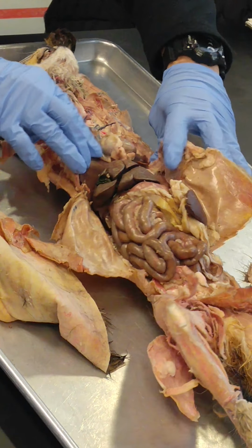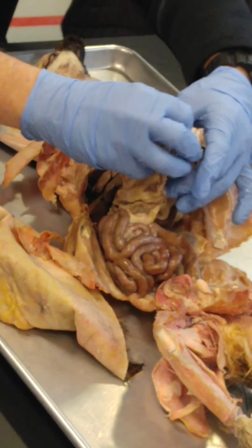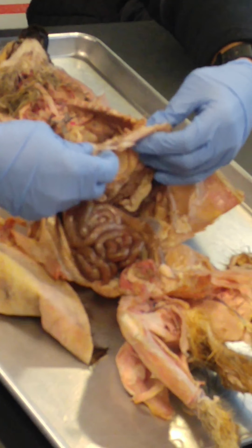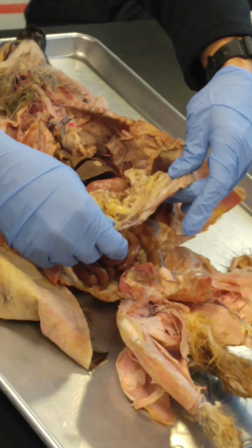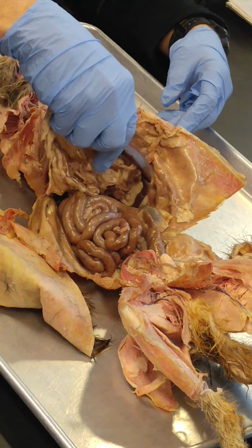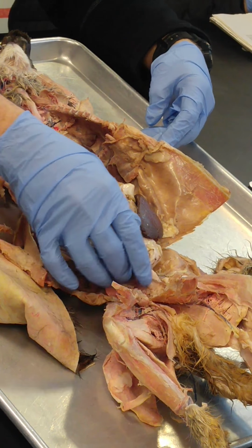Liver. So liver is pretty easy to find on this cat. Liver right there. Greater omentum. It's still intact. So the greater omentum is this little apron, little mesentery-like apron made of a double layer of the peritoneum that sits over the front of the abdominal contents, and it hangs down basically from the stomach, but it does accumulate fat. That's its function, basically, is to accumulate fat.